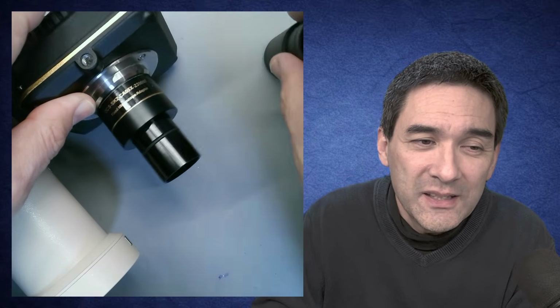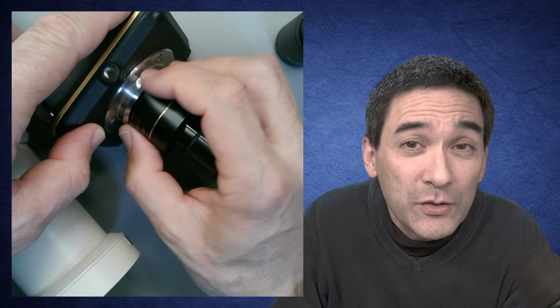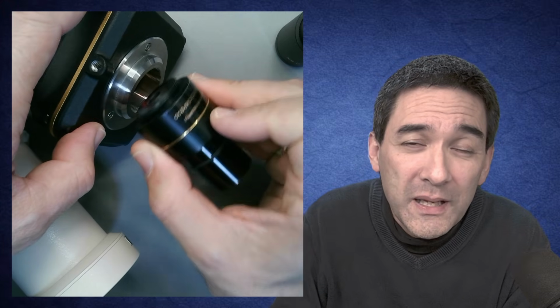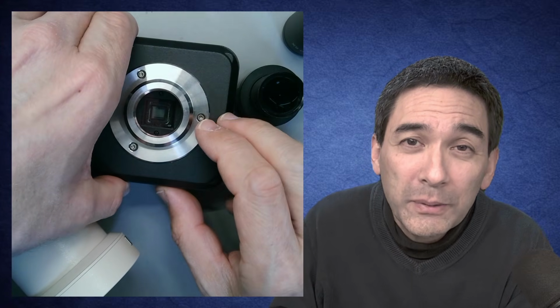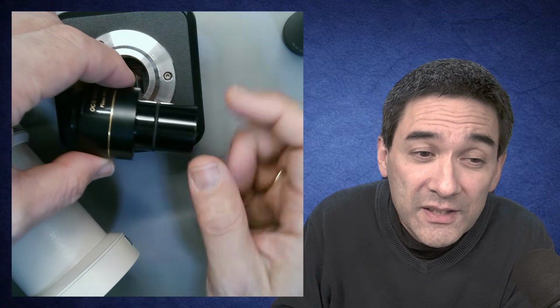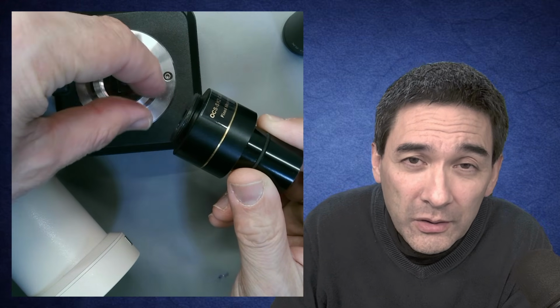In order to understand this, let's take away the intermediate optics of this camera here and have a look at the size of the sensor. Remember, this optic over here makes the image smaller, but notice that the camera sensor in here, the little rectangle that you see here, is smaller than this diameter over here. If you want to fit the complete microscope image on the sensor, the image comes from over here, the objective projects it in here, and then the image has to be made smaller so that it fits on the smaller sensor.